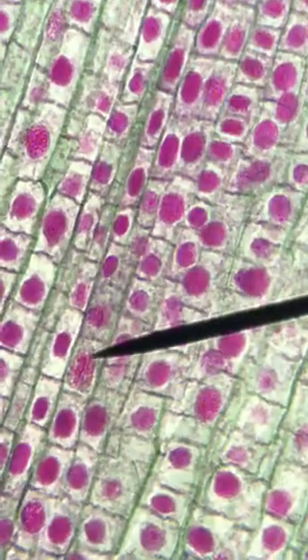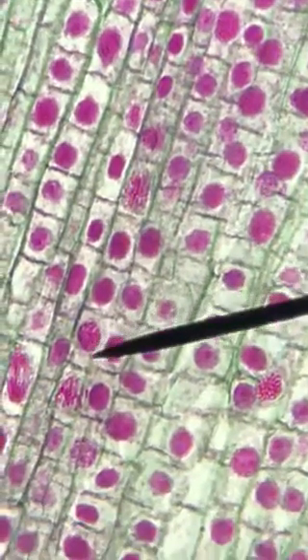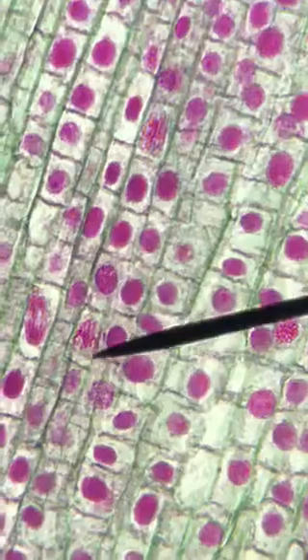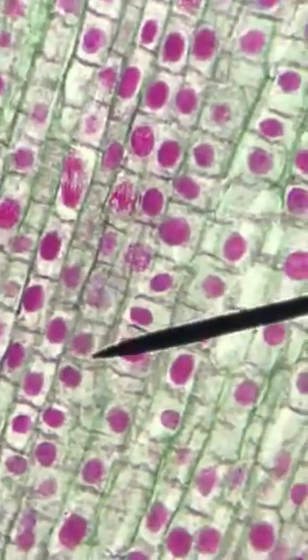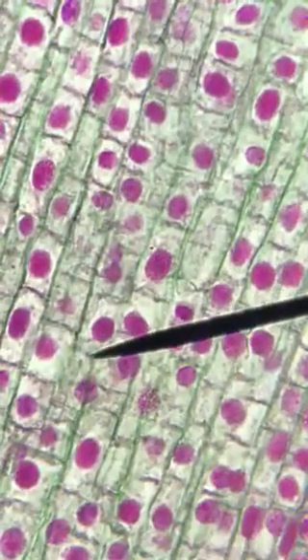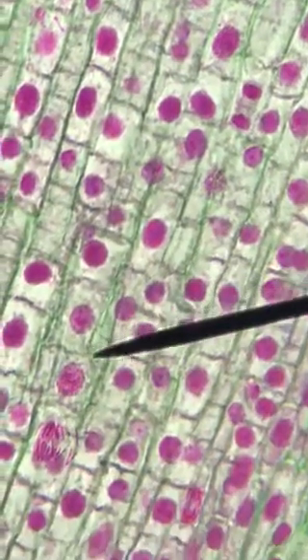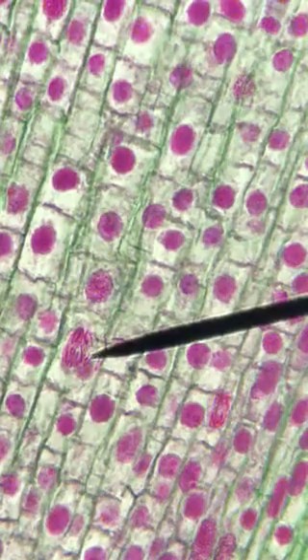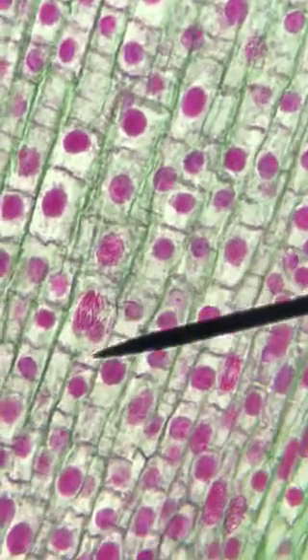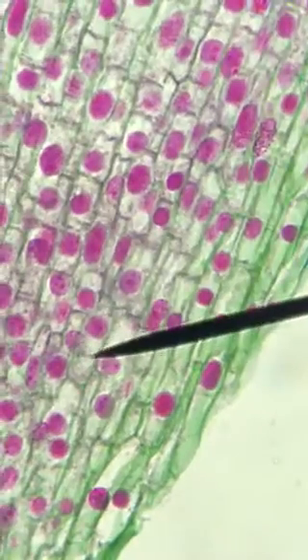This here, I would say, is probably metaphase. As we continue on, I would say that this is probably metaphase as well. Keep going along, maybe move this over just a little bit. Oops, wrong way. Now, prophase. Probably interphase. Get down to here. That's a really good example of probably the beginning stages of anaphase. I'm going to continue moving on. There's an interphase right there. Keep moving.